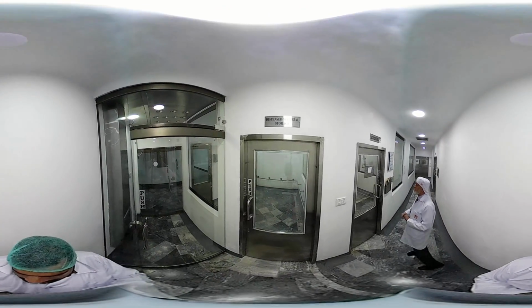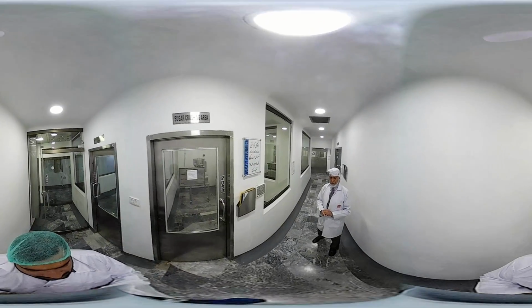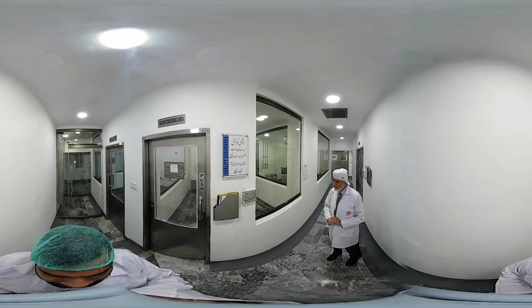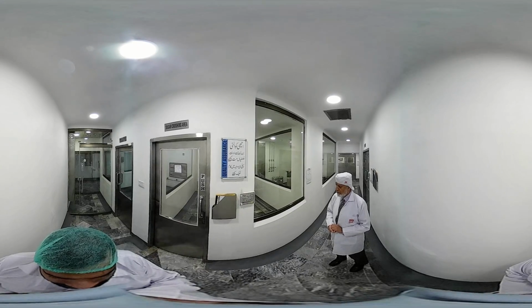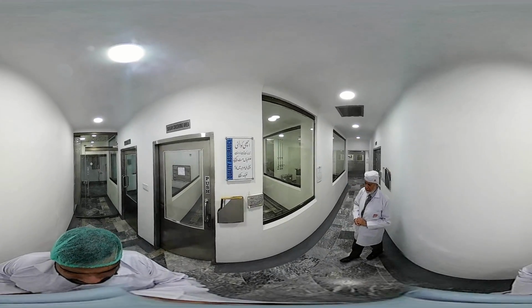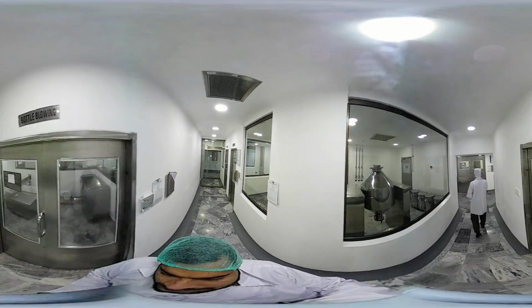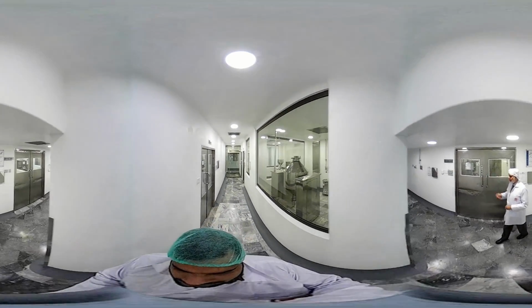The first one is the sugar crushing area. Obviously, we have dry powder suspensions, and the main ingredient, the main ratio, is the sugar itself. So we crush all those sugars because for dry powder suspension we need a specific particle size or grain. Once everything is done from that point of view, this front area is the wet mixing area.